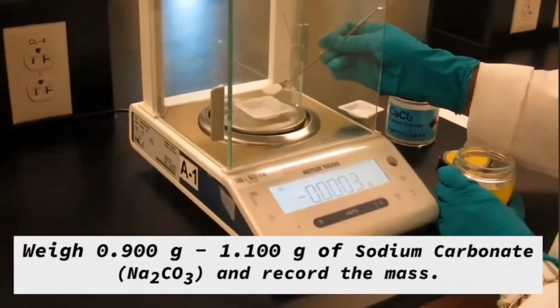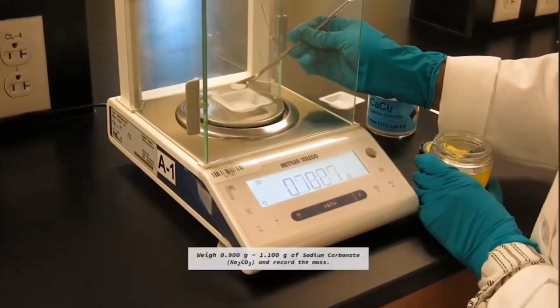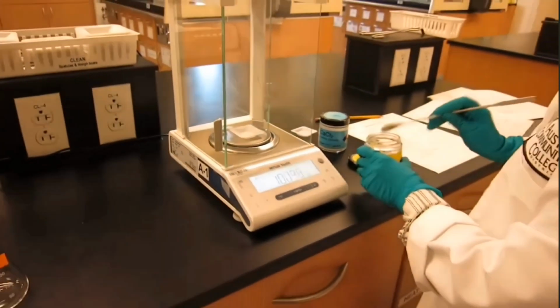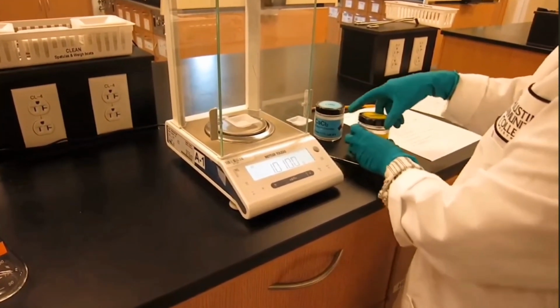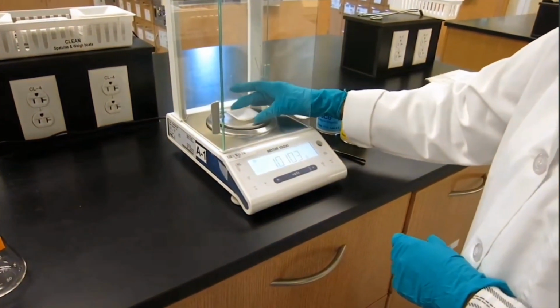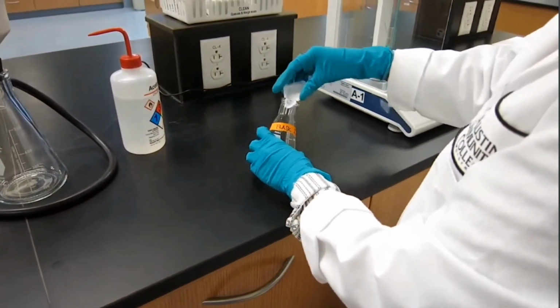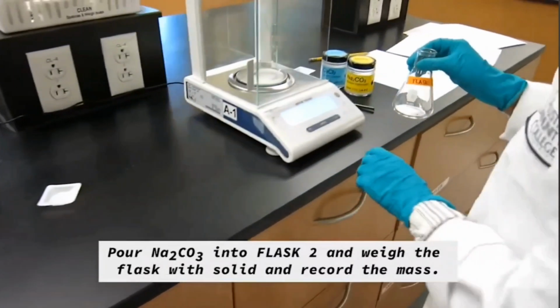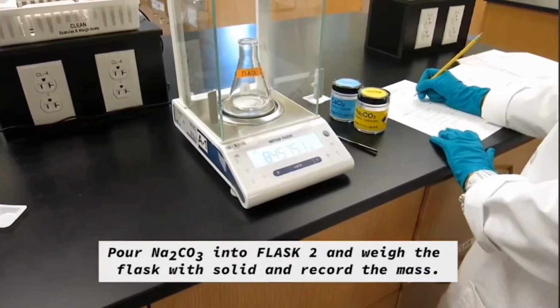So you're going to pour that amount into your weigh boat. And this will go to flask number 2. And you have to get the mass of the flask number 2 with sodium carbonate.